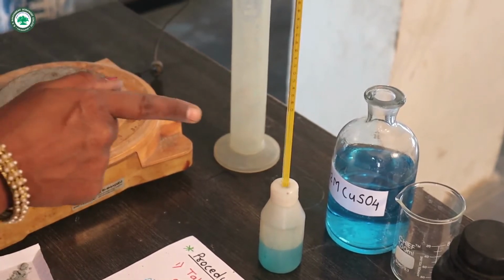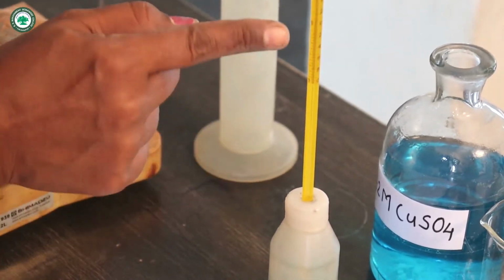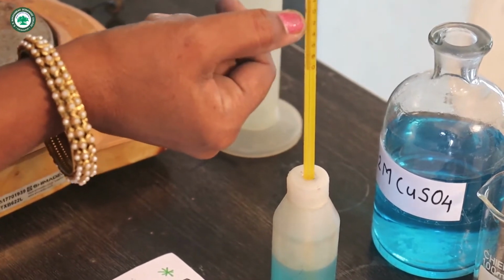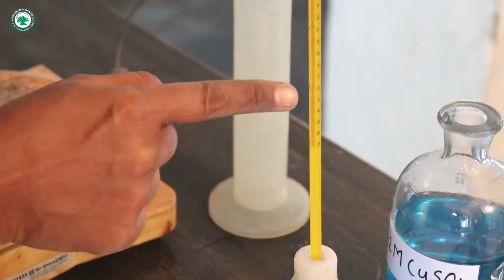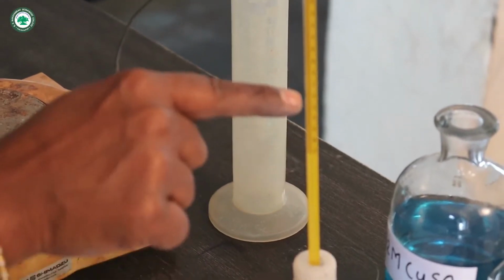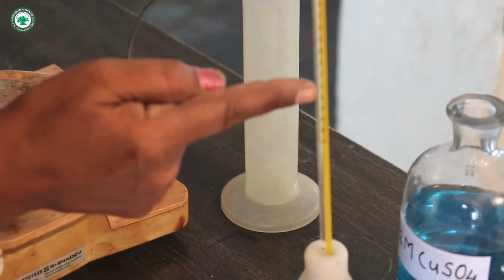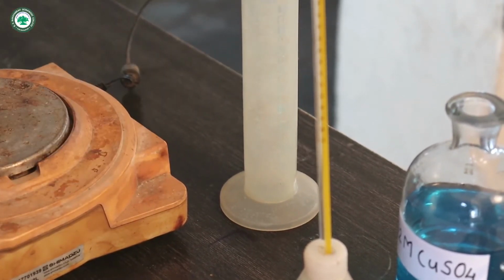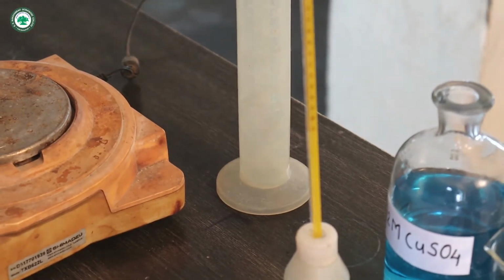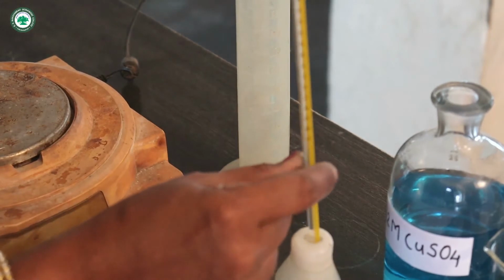And now let us see here how to measure that temperature. Here 0 and here 0, that means whatever line is there indicates the 0 line. And here below is the negative temperature, and between 0 and 2, 20 lines are there. That means here one line is for 0.1 reading. And so here we will measure the temperature.